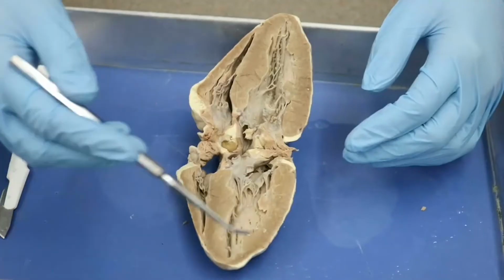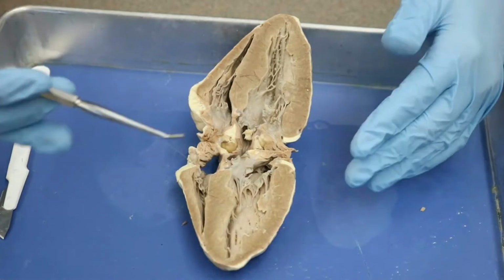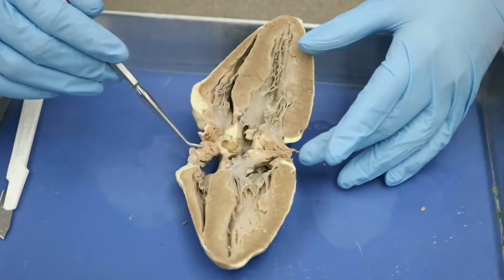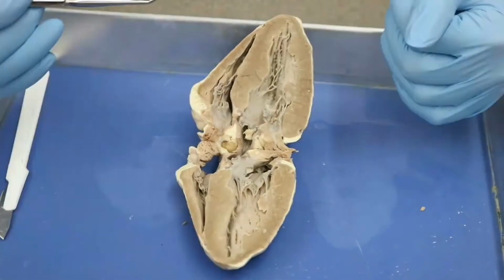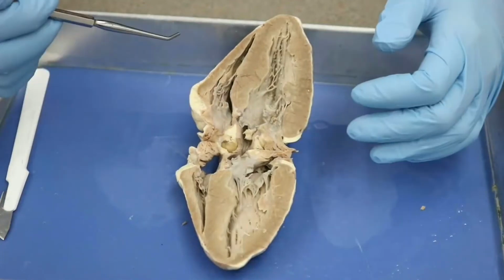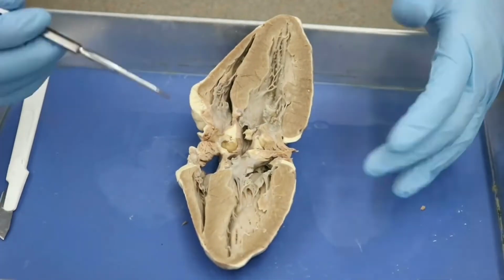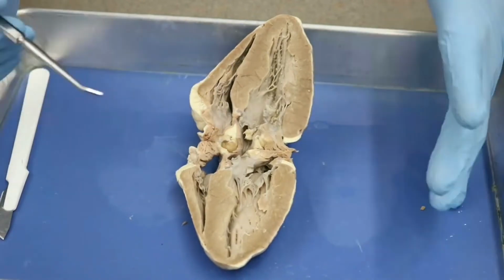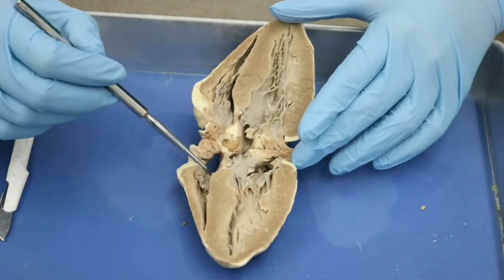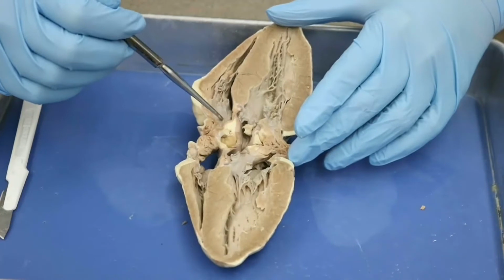All right, guys, so we are now looking at the fully bisected heart. This is still a coronal cut. I've just opened it up a little bit here so that it sits open by itself. Of course, when I did that, it broke our mitral valve, which is why I didn't do it earlier. But now that we're nicely laid out, let's make sure we're well oriented. So up in here, this is going to be our right atrium. Now, our right atrium would also be over in this area.